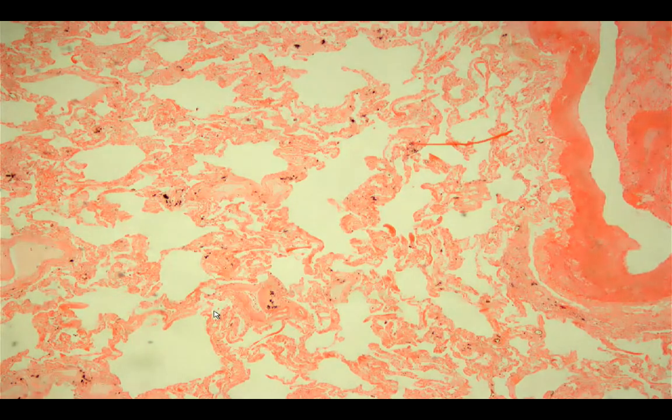We also need to look at adjacent structures for any sign of complications. If there is an occlusion of the blood vessels, one of the complications would be ischemia or necrosis. In this case, you still see viable alveolar walls, so this is more of a chronic pulmonary embolism.